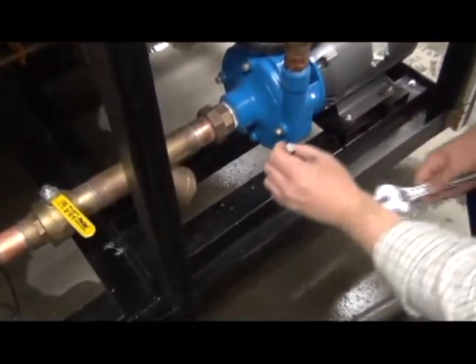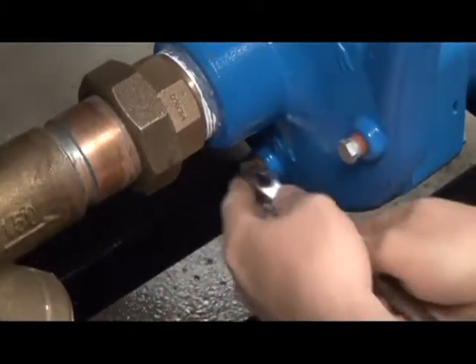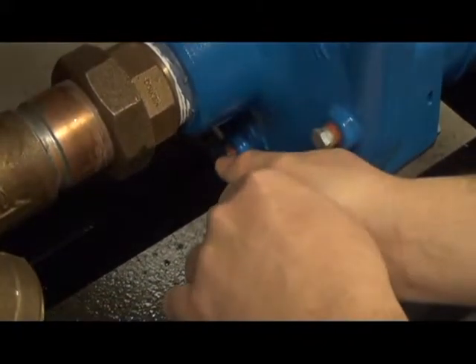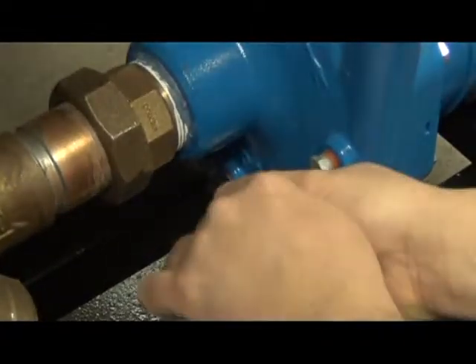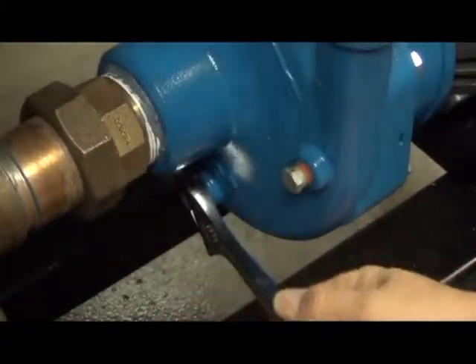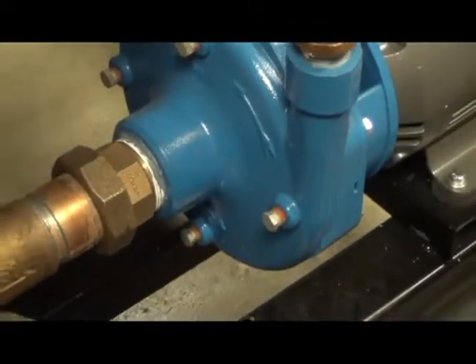On the left end of the unit, where the connections and electrical box are located, you'll find a tag inside the electrical box reminding you that the pump plug has been removed for shipment. You must locate this plug and reinstall it before filling the unit. So using a 9-16ths or your adjustable wrench, you'll install the pump plug into the pump housing. And you'll just want to make sure that it's good and tight so that we won't have any leaks. The pump plug is always located at the bottom of the pump.